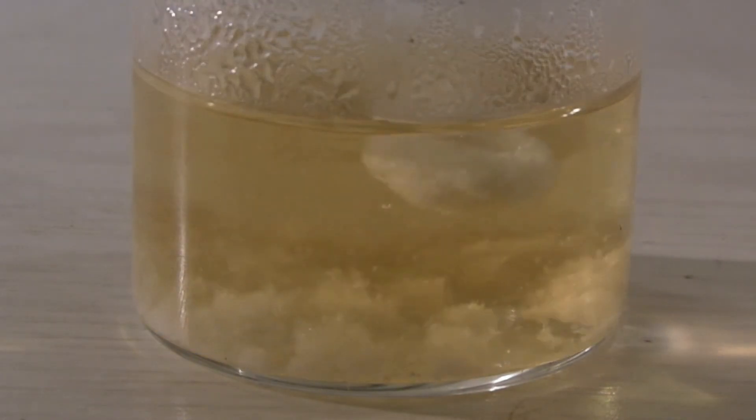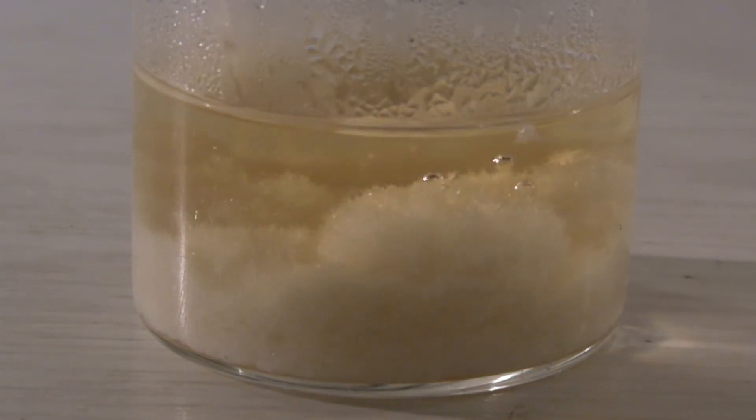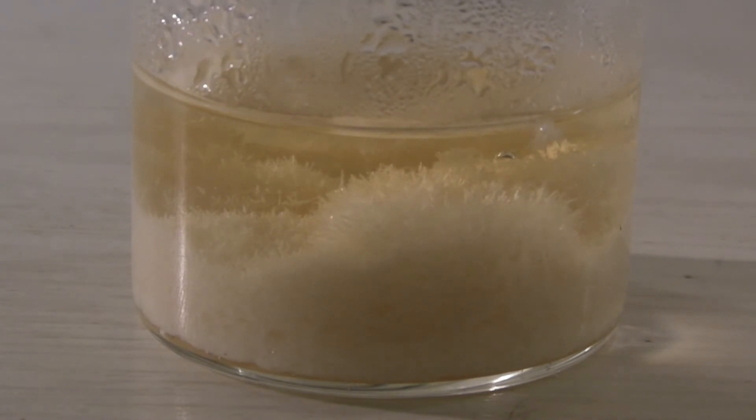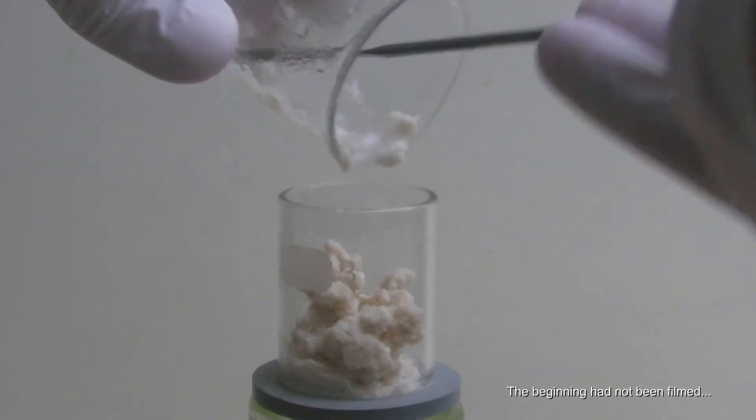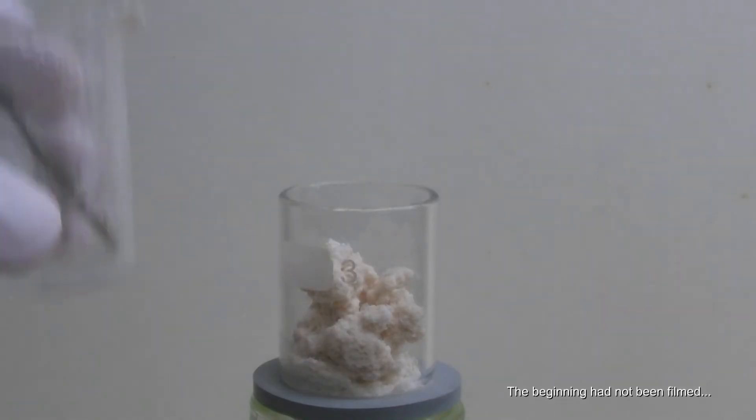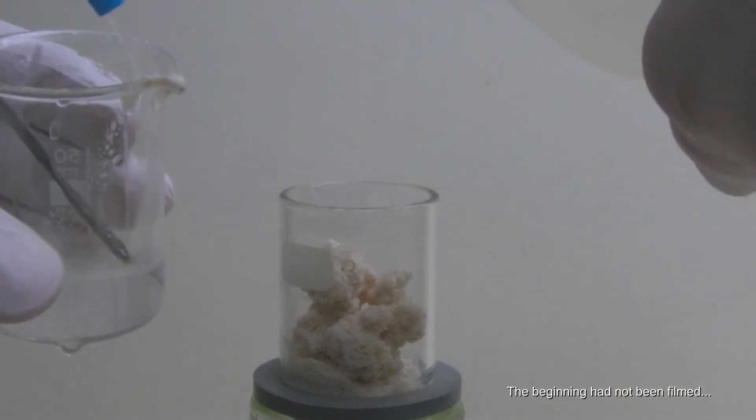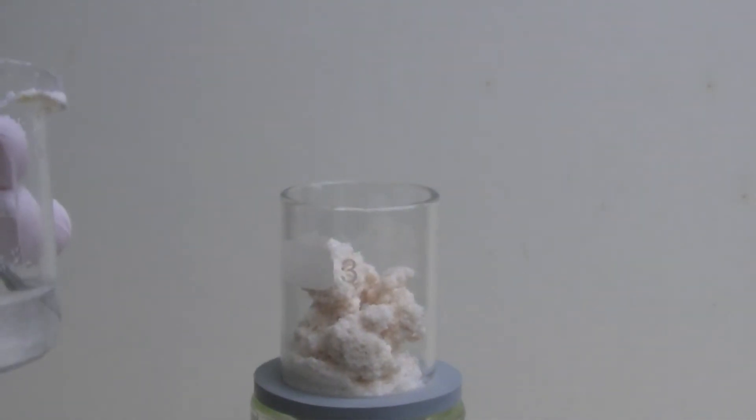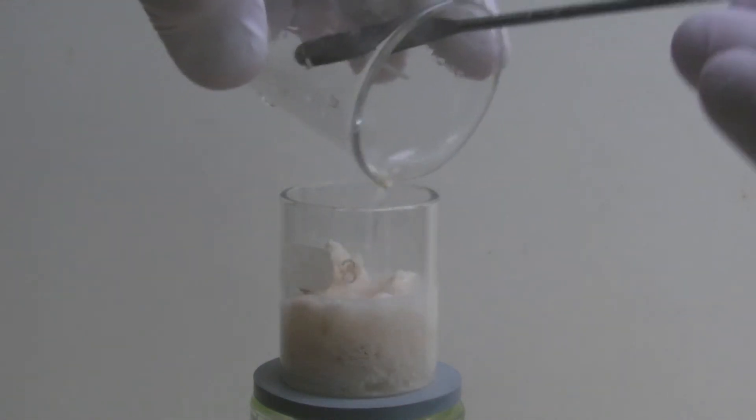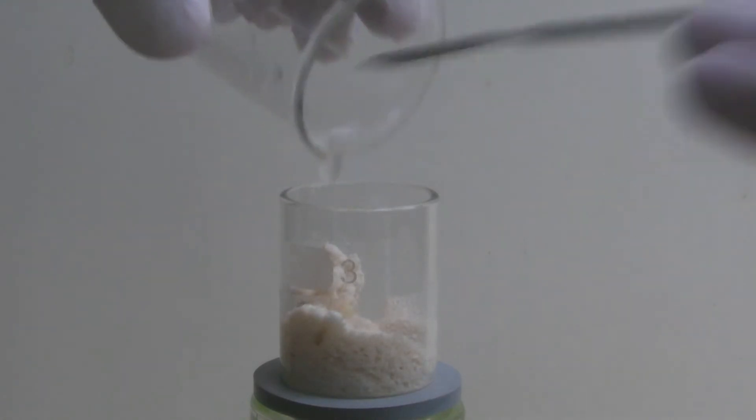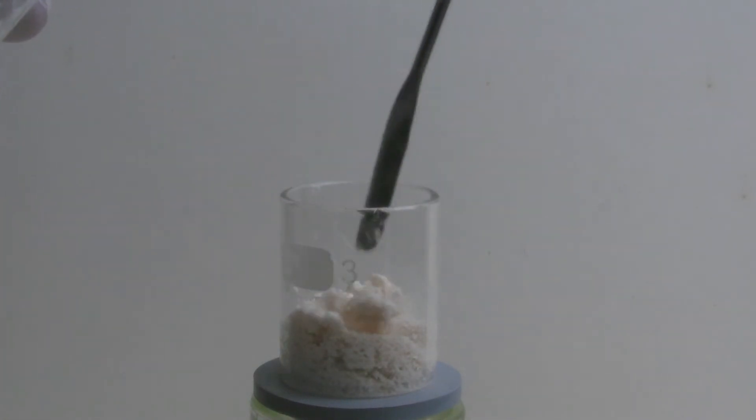This time fine needle-shaped crystals did form that could then be filtered off. The beaker was washed out with some water. At the end the product itself was washed with water.